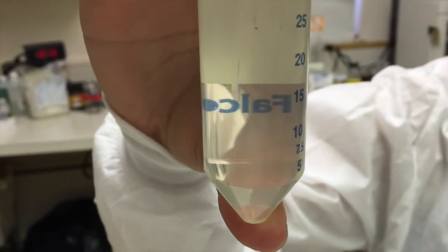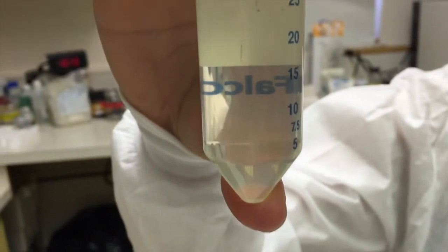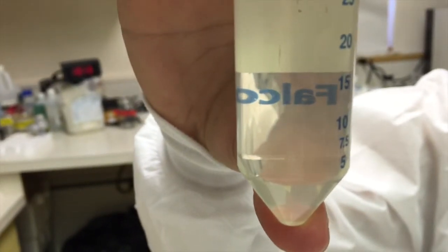So as you can see, the biodiesel has reacted with the methanol, and no particles are left behind, which is a pass.